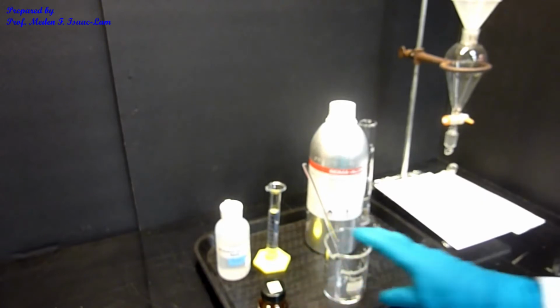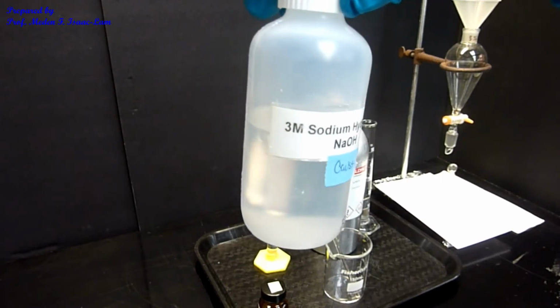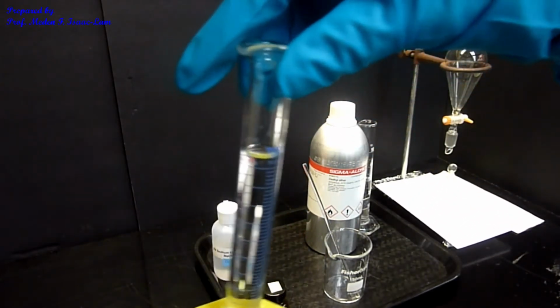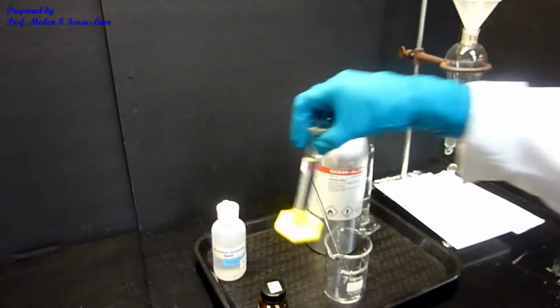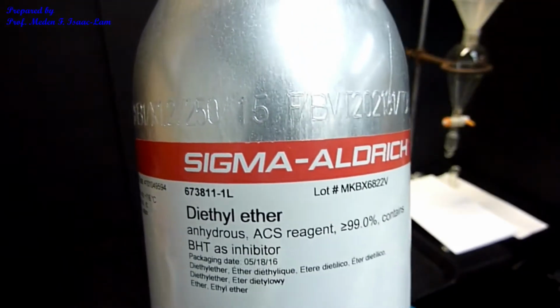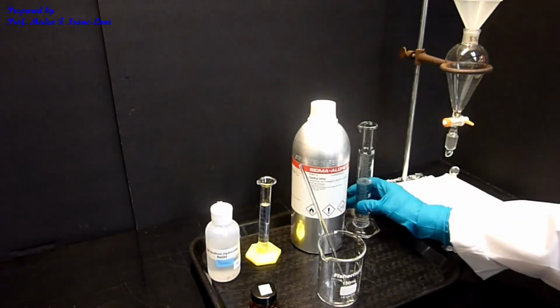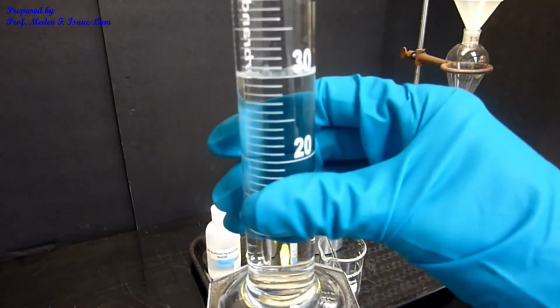So I have everything in here. I have the base, which is sodium hydroxide, 3 molar sodium hydroxide, and I already measured 10 mils of it in a graduated cylinder. We also have the solvent, which we're going to be using, and this is diethyl ether. It's in a canister. And I also measured already the ether, which is about 30 ml in a graduated cylinder.